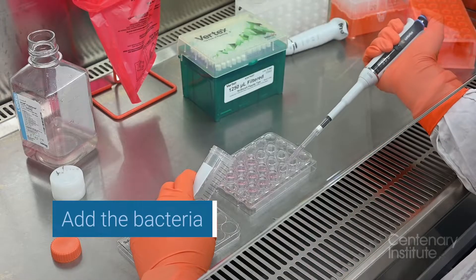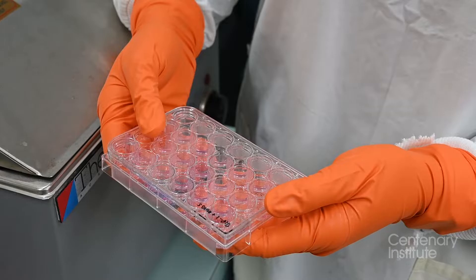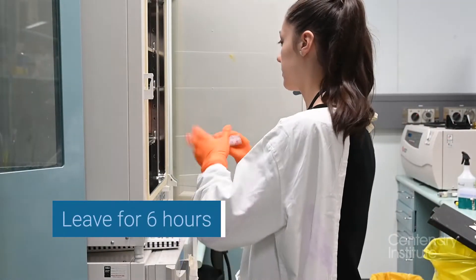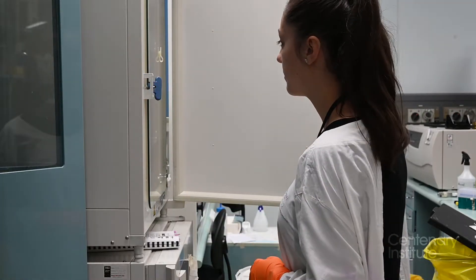After this we add bacteria to the cells, and after all of that preparation our cells are ready to go into the incubator. Now I need to give time for the bacteria to infect them.